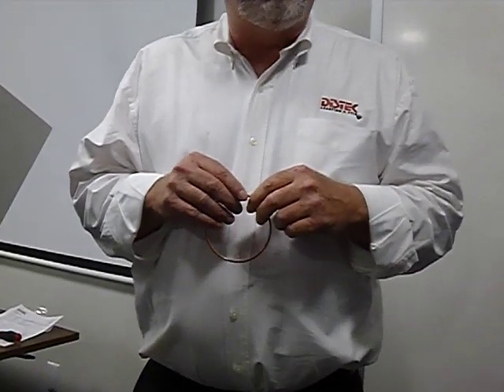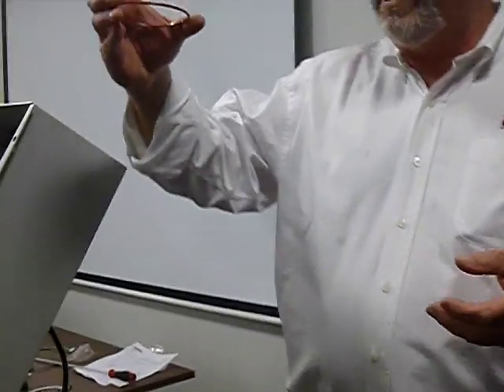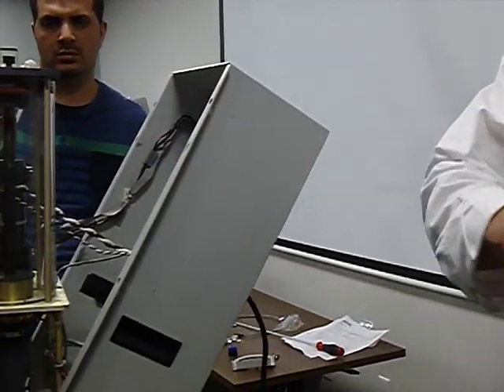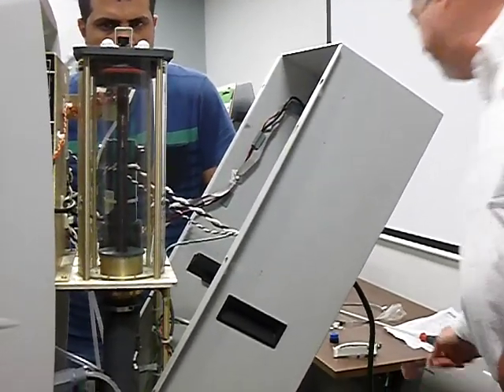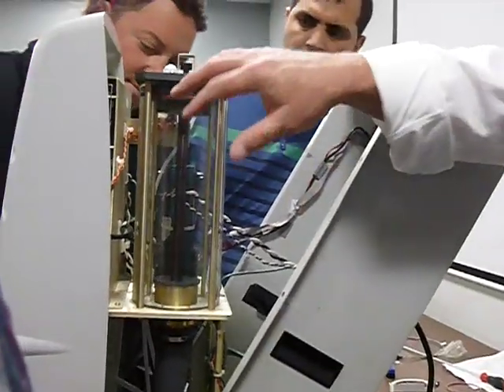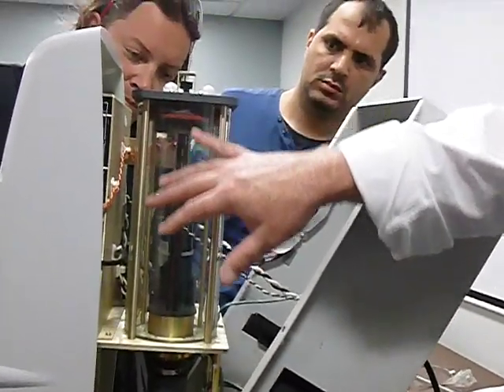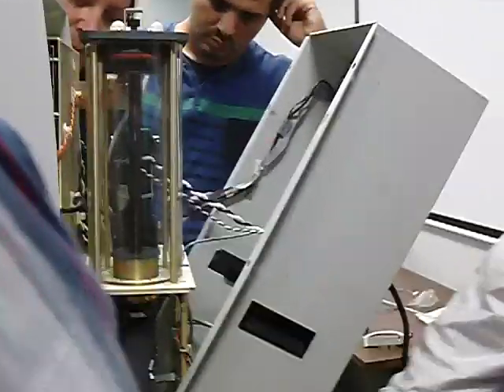When he says it's a noise, a lot of times in the beginning when you start it up, the noise will go down because it's dry. It's like putting a windshield wiper blade on a car. So it's going to come down. What's creating the vacuum? This coming down. That's creating the vacuum, so it's going to suck up the media. It's going to come in here and go around the loop.